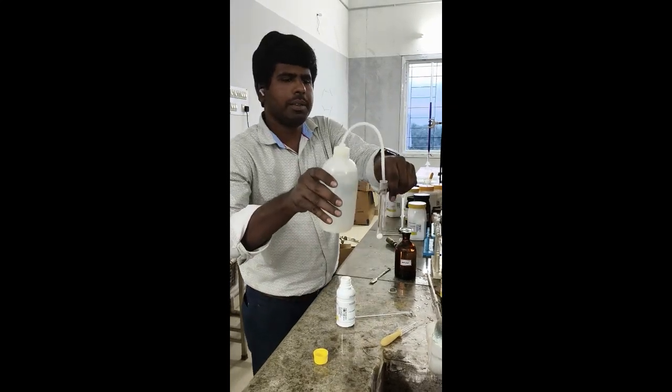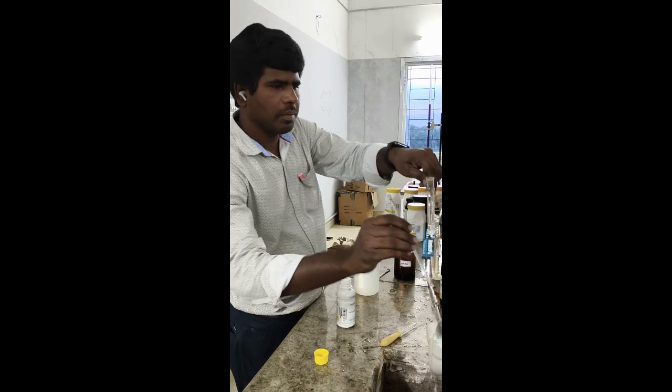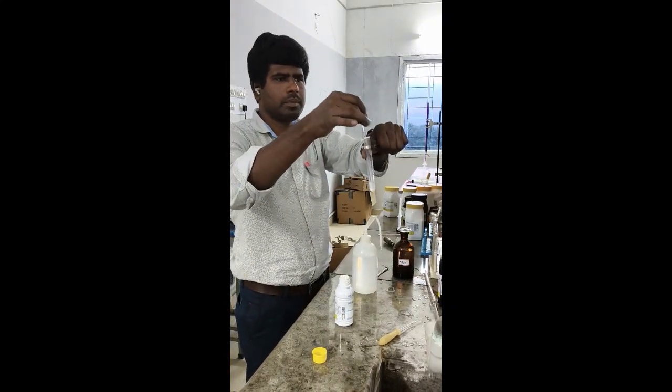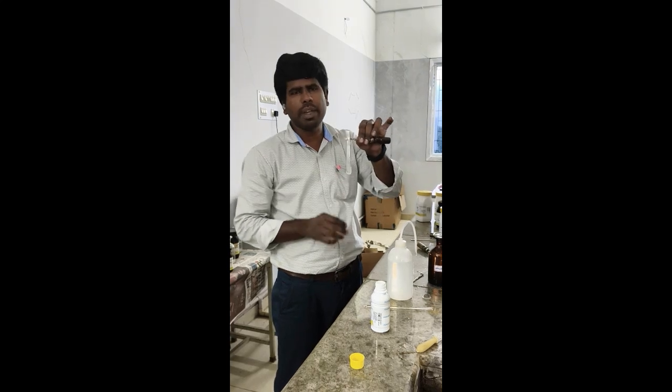Dissolve with water. Now add dilute HCl and barium chloride solution. You will get white precipitate.